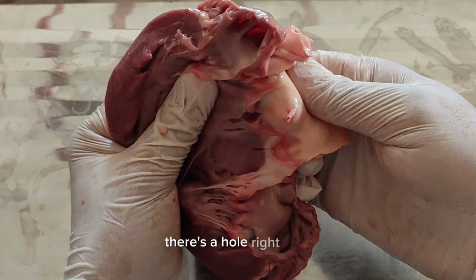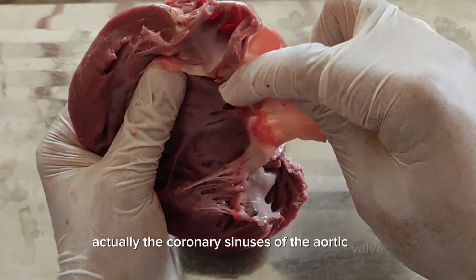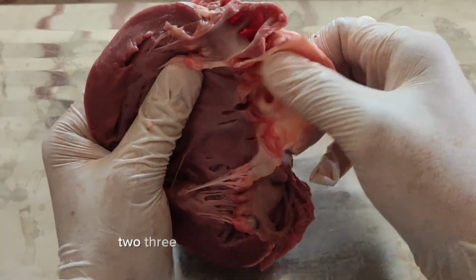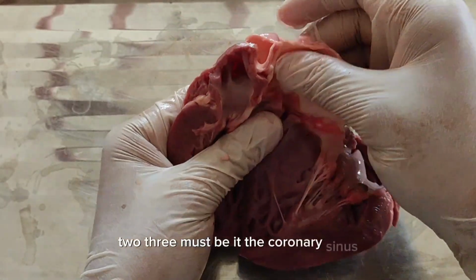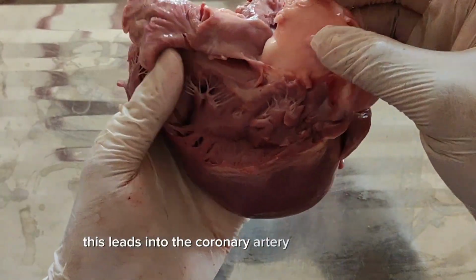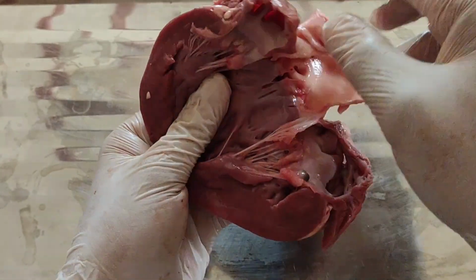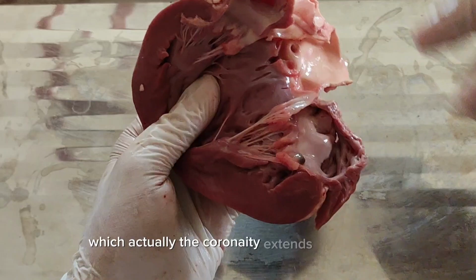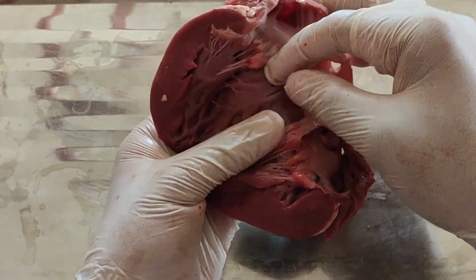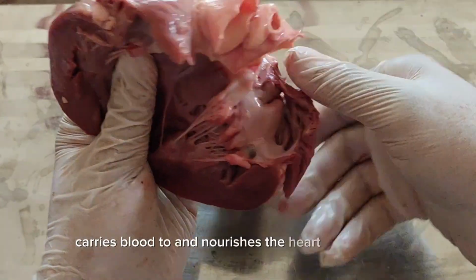There are holes right here. It's actually the coronary sinuses of the aortic valve. Here we have holes in here, 1, 2, 3. It must be it, the coronary sinus. This leads into the coronary artery, which extends to the heart, back and front. And these coronary arteries carry blood to and nourish the heart muscle itself.